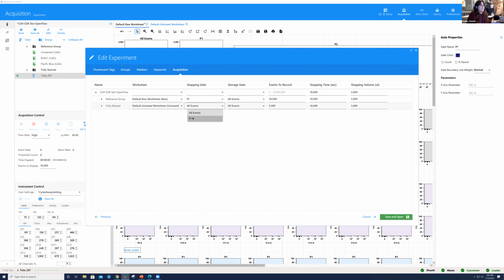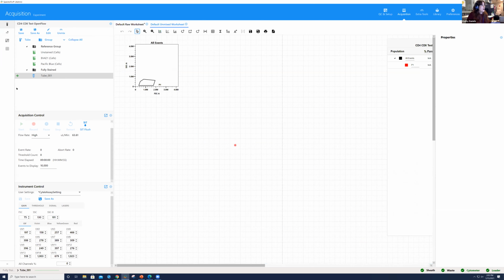And again, let me make sure from my scatter gate, I'm recording enough events, and I'm going to go for 20,000 again, okay? I do have the capability to toggle back and forth between worksheets, but I want it to automatically be set so that this is looking at my unmixed, okay? I'm going to take the fully stained sample and load it on and see what our CD4, CD8 combination looks like with PAC blue and BV421.